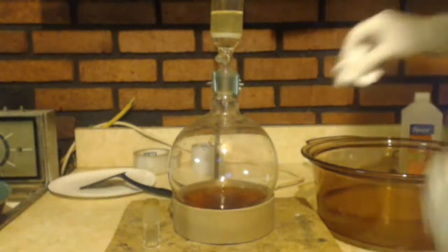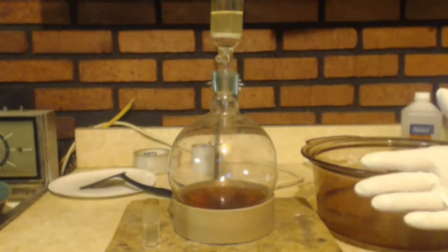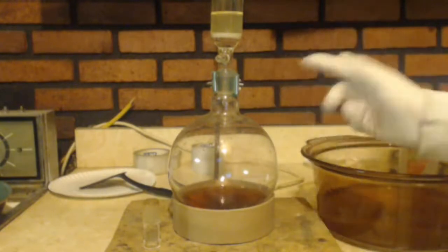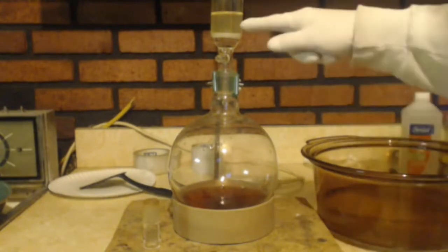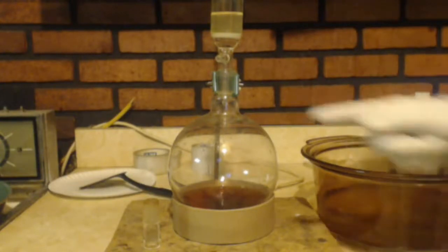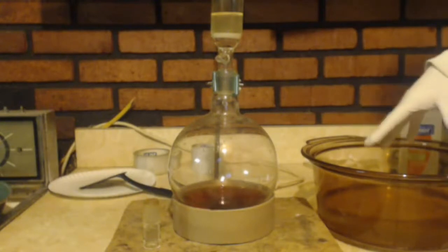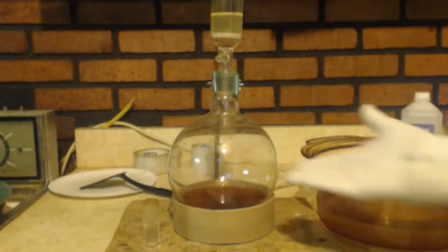So I'm adding sodium hydroxide to this iodine water solution so I can make the, just like when you add chlorine to sodium hydroxide, you make sodium hypochlorite. Here, I'm doing the same thing, except I'm adding it in reverse. I got your iodine there. It's mixing with the sodium hydroxide solution, and you're making your sodium hypoiodite. So I'm just going to pour this in. This has no lip on here, so I'm going to do this off the camera so I have room. And basically that's it. I'm just going to let that drip in, and there's your salt.